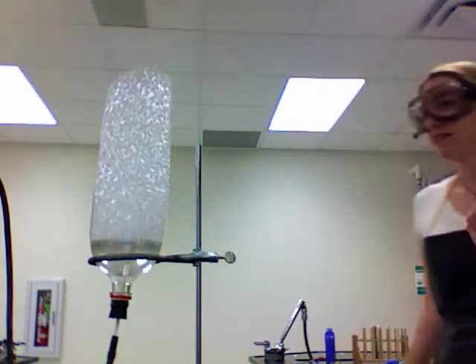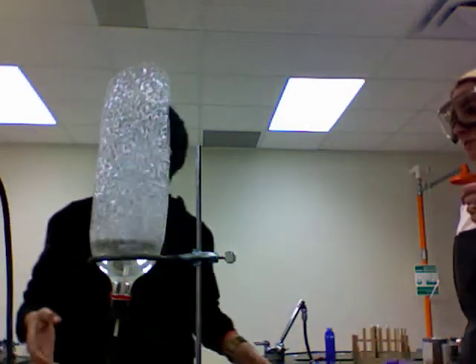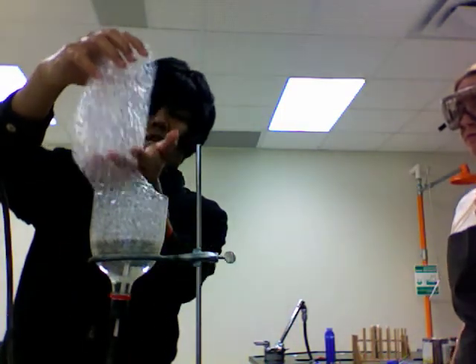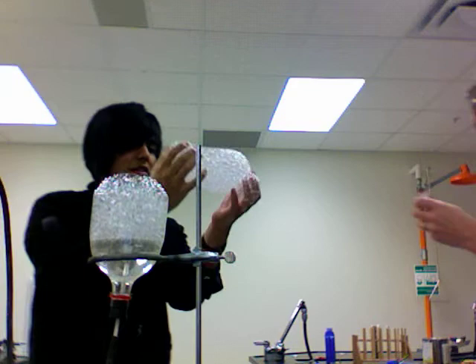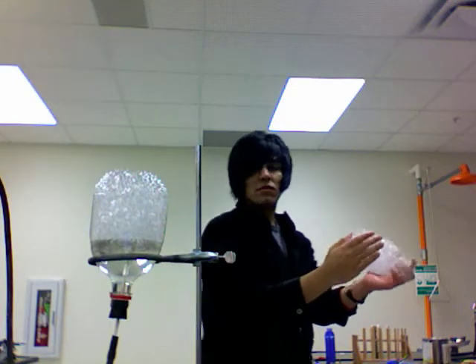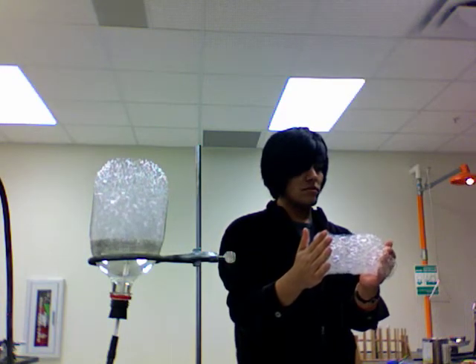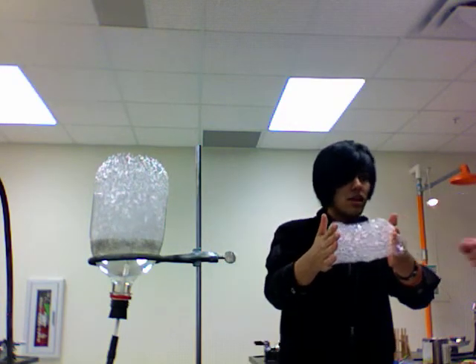All right, see if you can cut that in half — scoop the top half off so you basically have two. Go! Methane mamba — put the tube straight in here, straighten your arms out. There you go! Woo, fun stuff.